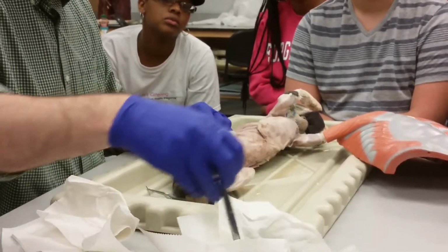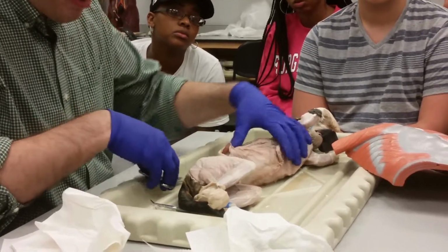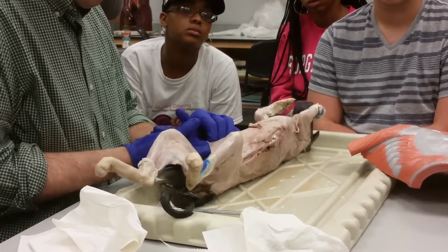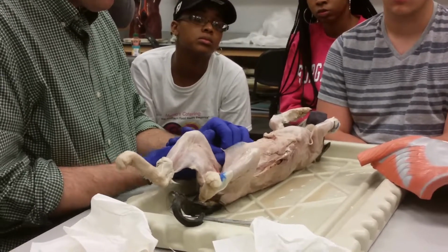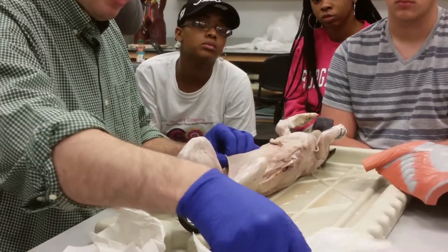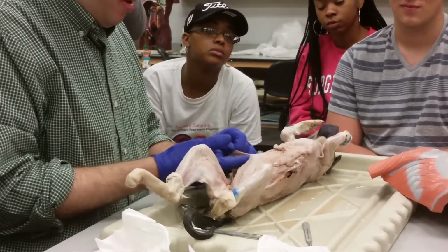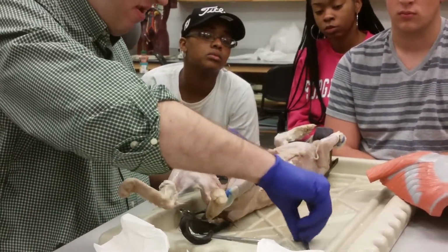So I'm just going to take these scissors and cut along that way. I'll use my scalpel instead, a little more accurate. Usually what I do is stick my glove under there and see, okay, I don't see any muscle fibers. It's not fat, it's just fascia, so I know I can cut that. Some people are disturbed by the sound of that, but it's just collagen fibers. Like cutting leather.